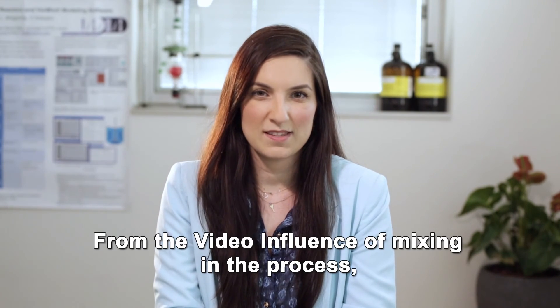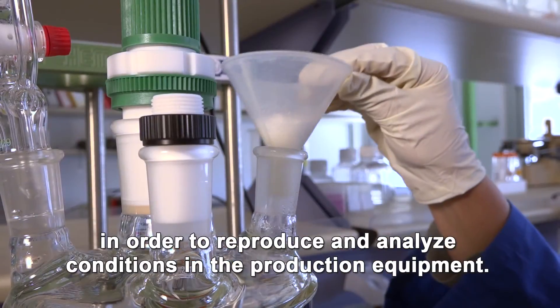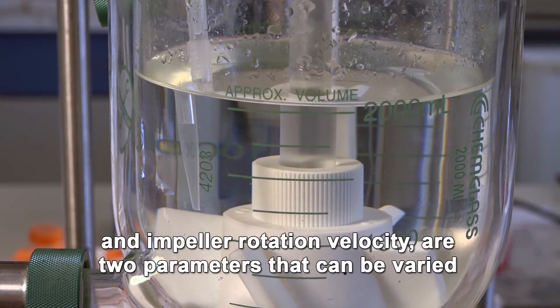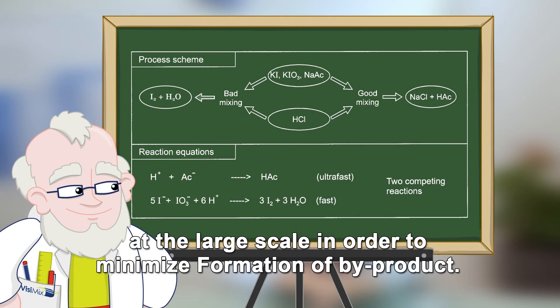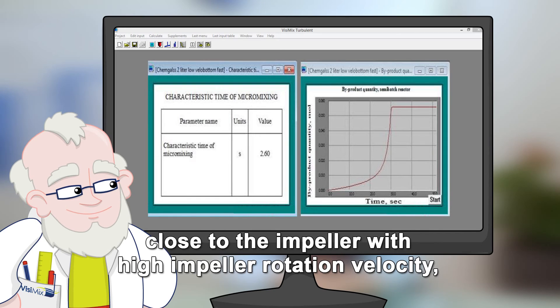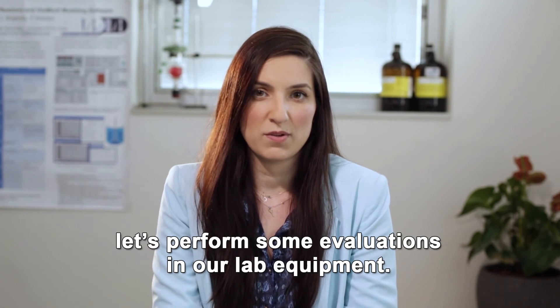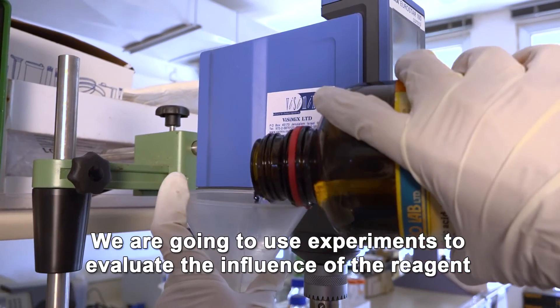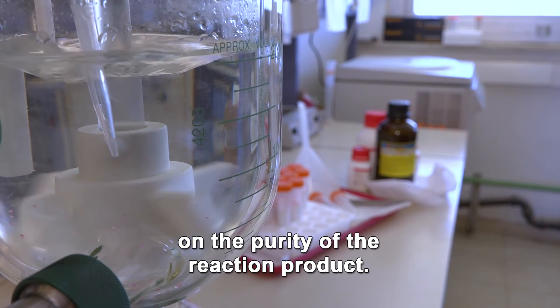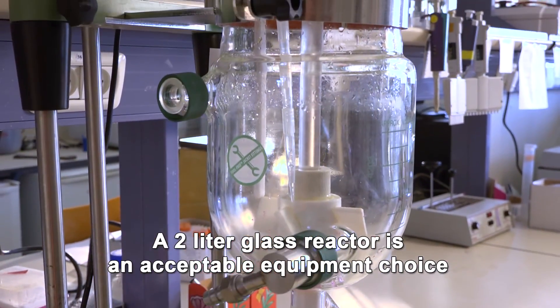From the video 'Influence of Mixing in the Process,' we're going to determine how to set up the lab equipment. Our purpose is to make relevant lab scale experiments in order to reproduce and analyze conditions in the production equipment. In this example, we can assume that the reagent feed position and impeller rotation velocity are two parameters that can be varied at the large scale in order to minimize formation of by-product. We have finished our calculations and found that the feed position close to the impeller with a high impeller rotation velocity helps to achieve our goal and get good results. In order to confirm this conclusion, let's perform some evaluations in our lab equipment using a 2L glass reactor.